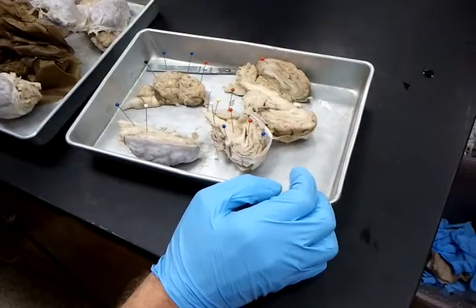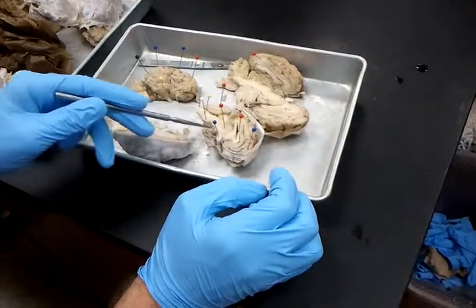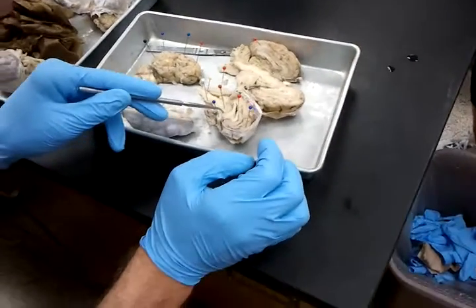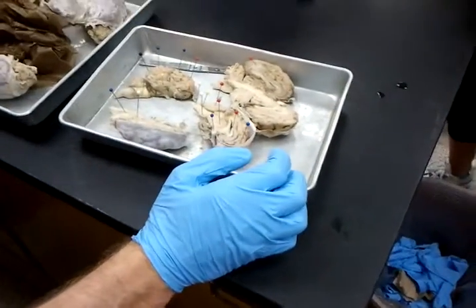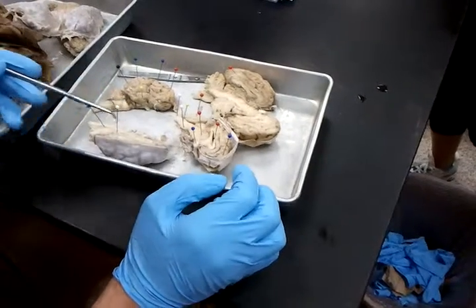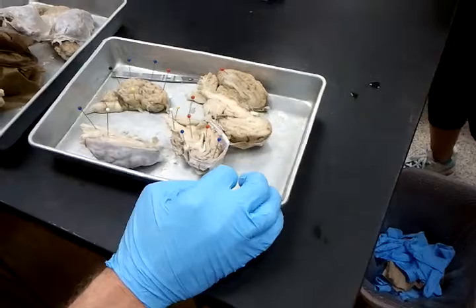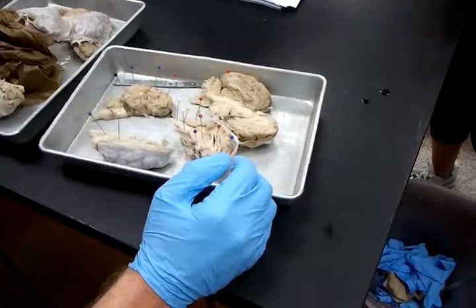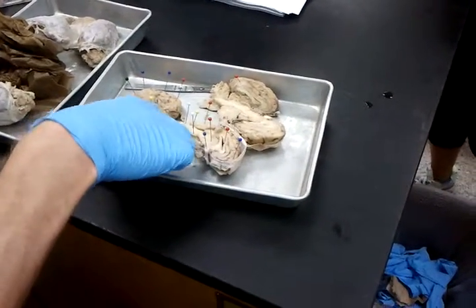The third ventricle, I'm pretty sure I don't have identified out here. I think it exists within the thalamus here, so I'm not going to have you guys. Isn't it? I think in the book it said the third is the thalamus. It makes up that whole thing, I think is what it said. That may be right, but look it up again. I'm not going to have it out on the brain. Because even if you're right, that means I'd have like 3 or 4 pins in the same area. Be ridiculous. A little baby brain. So forget about the third for a dissection.